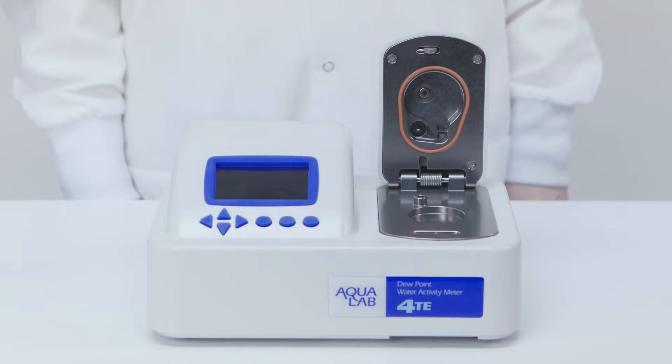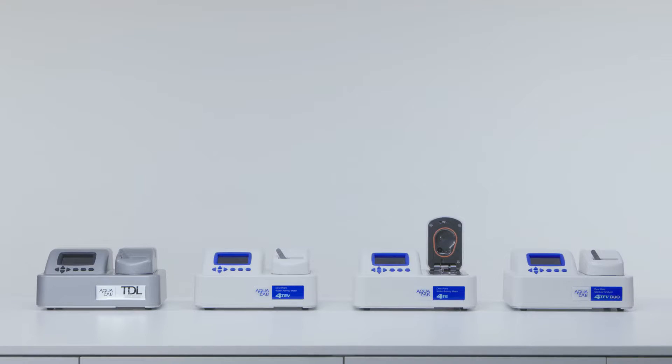This video will certify you to use Aqualab 4 series water activity meters. Today we'll be using this Aqualab 4TE and 4TEV, but the instructions also apply to the Aqualab 4 and DUO.